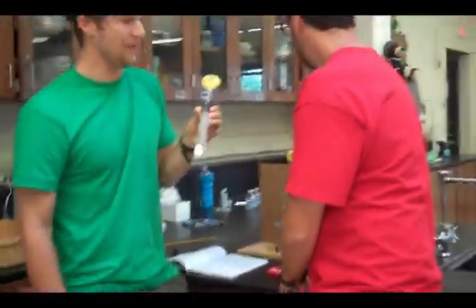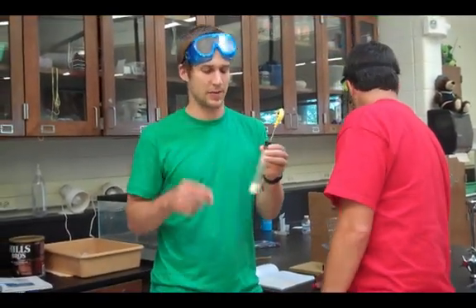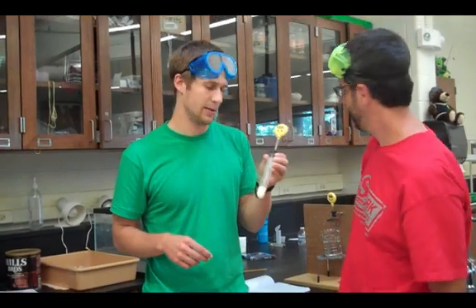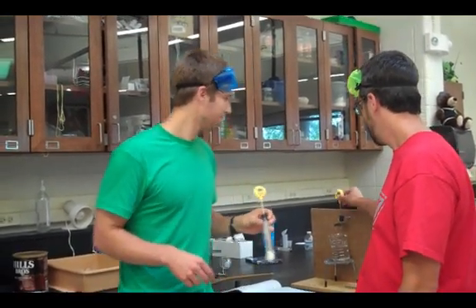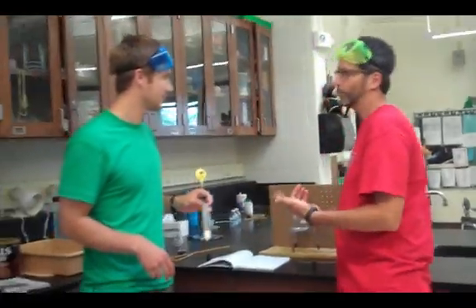So to clean up, I can leave this thermometer because it's actually frozen in the substance, so I'm going to leave that thermometer in the test tube. Take that out. Pour the water in the sink.